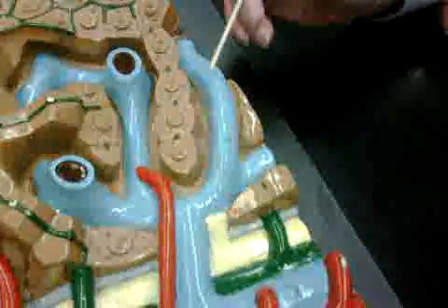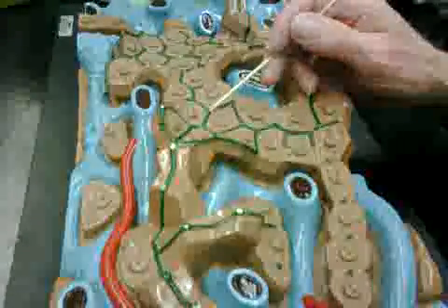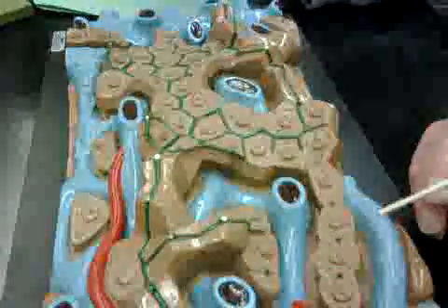Then the sinuses are lined by Kupffer cells, which are like macrophages, fixed macrophages. You know, most macrophages wander around the tissues. These stay fixed right there. And they'll gobble up debris and stuff that comes in with the blood. These thin green elements here are bile canaliculi, tiny little bile canals, bile canaliculi. And of course, these are hepatocytes, or hepatic cells.